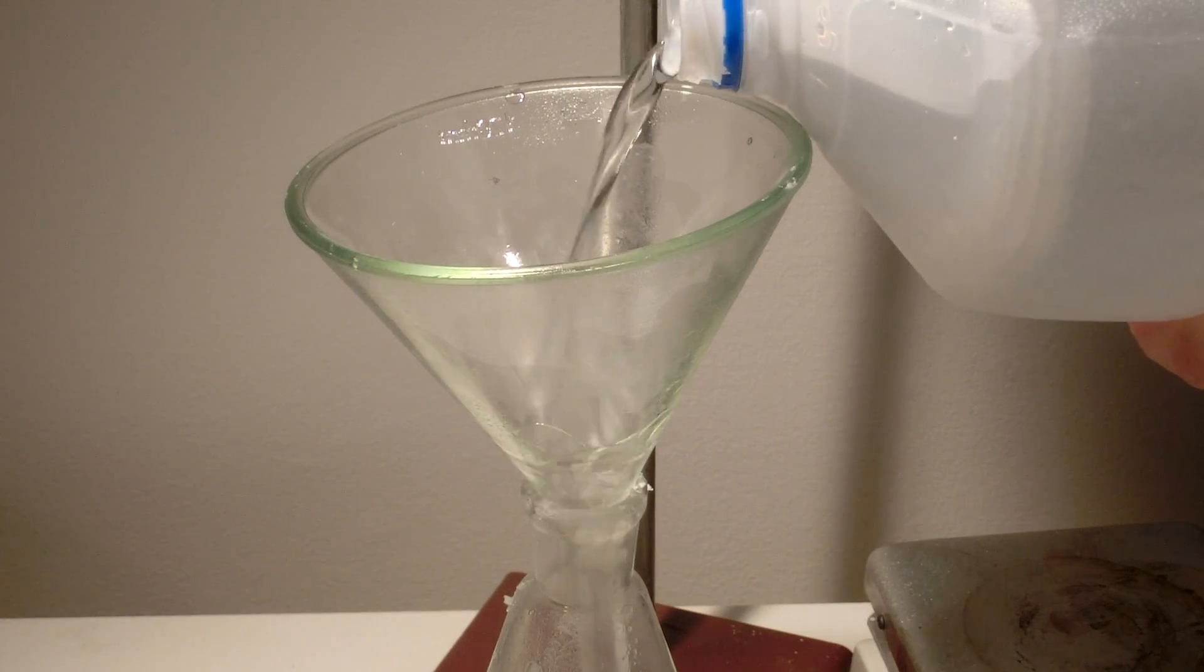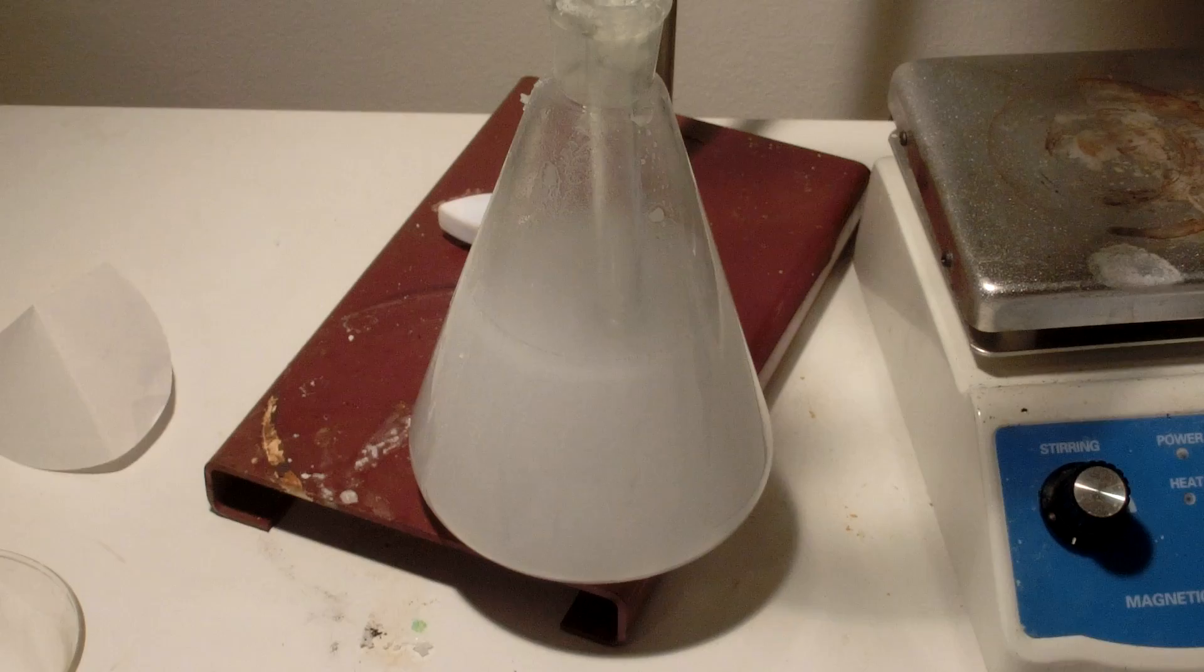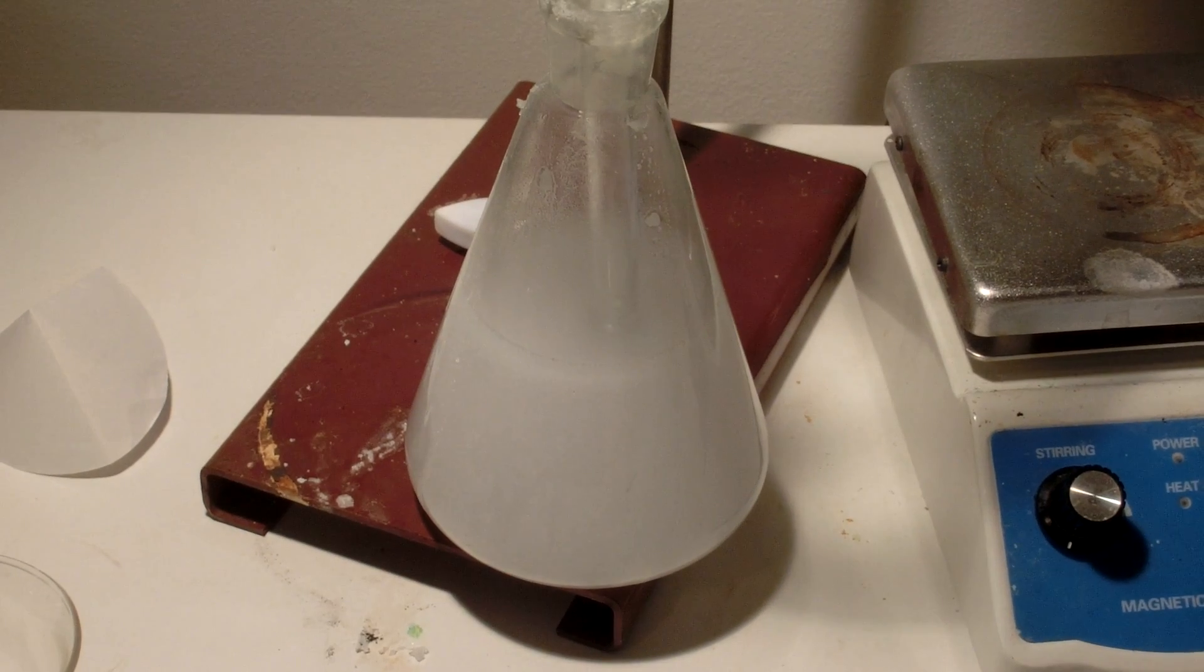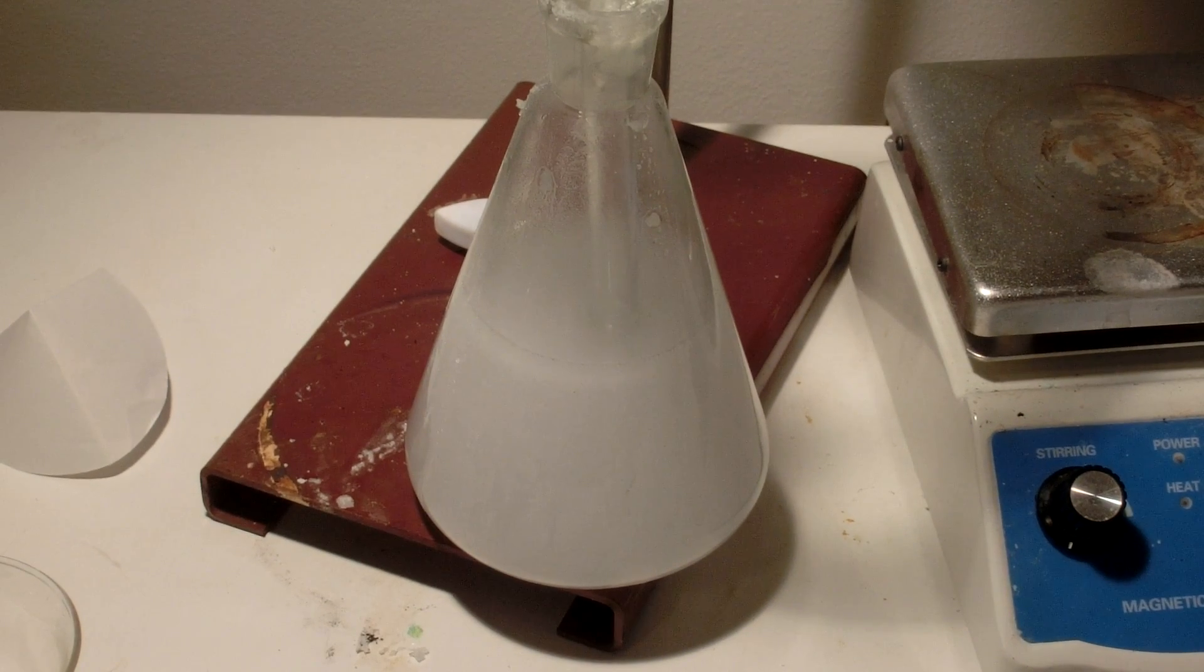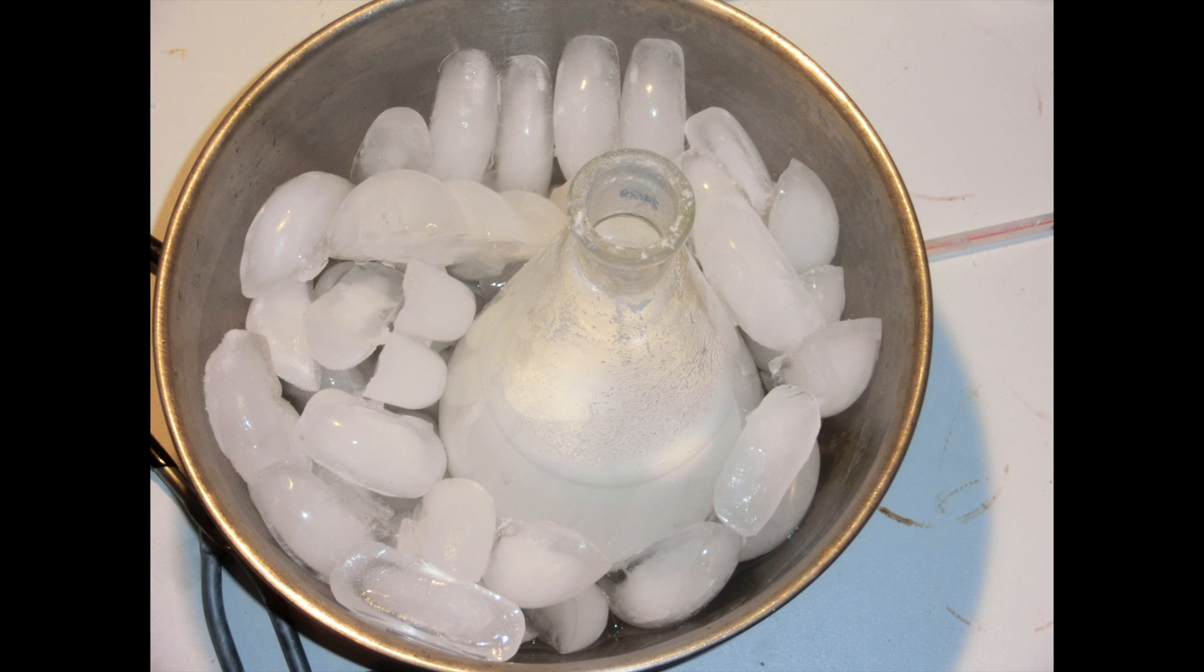After that, an equal quantity of ice-cold distilled water should be added. Most acetylsalicylic acid will precipitate due to its low solubility in water. It should then be added to an ice bath.